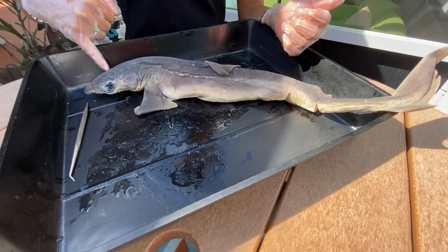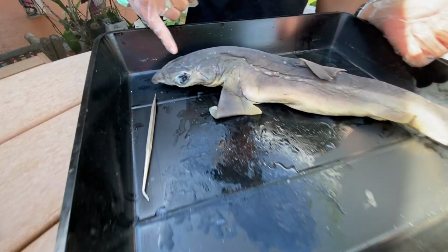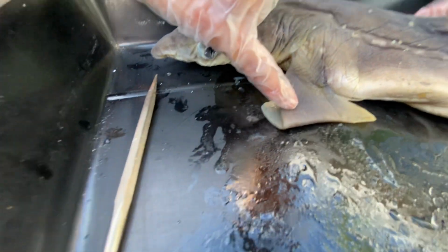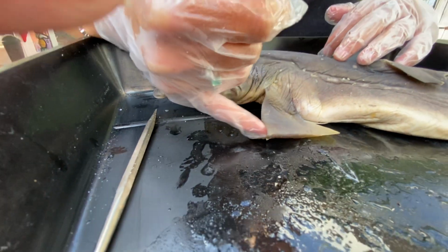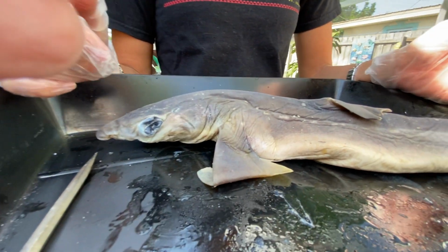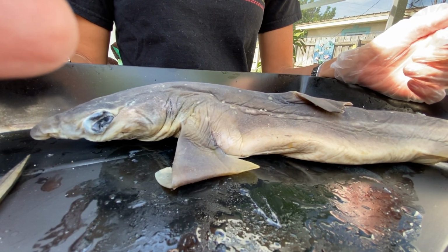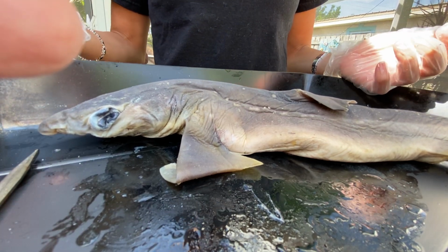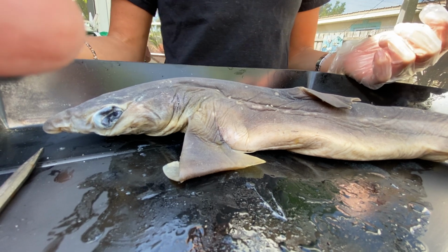This nose piece right here, how it's tapered rostrum, also provides a little bit of lift. So between the tapered rostrum and the pectoral fins, you have two upward thrust locations that will offset the heterocercal caudal fin's downward thrust.